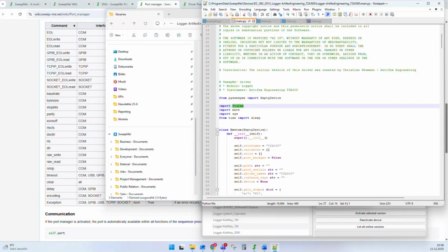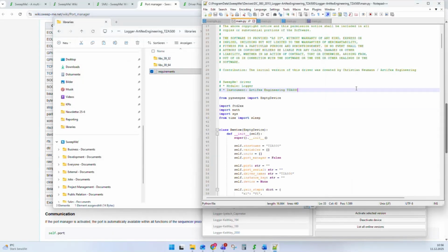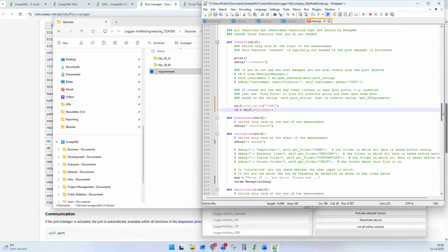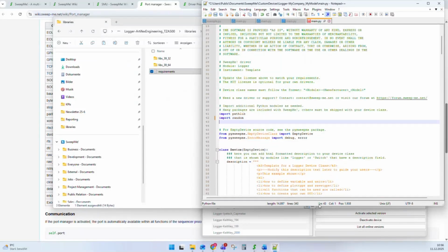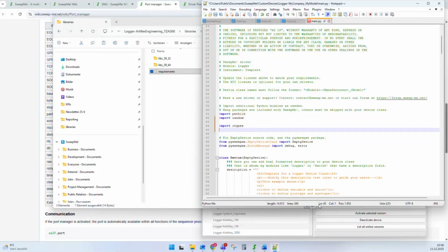And sometimes you also have to add libraries in terms of dynamic link libraries. It means CDLLs or .NET DLLs. Again, you can add these DLLs to your libraries folder and to your driver. Then you typically have to use libraries like, here I have to go into the other driver that I can modify. Here you have to use libraries like import ctypes for loading DLLs, or you can use import clr for loading .NET DLLs.